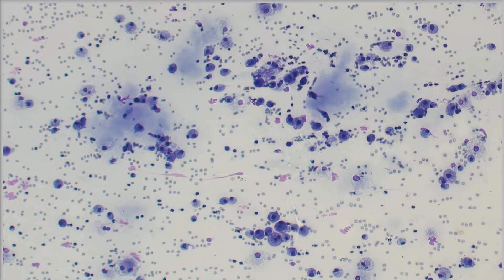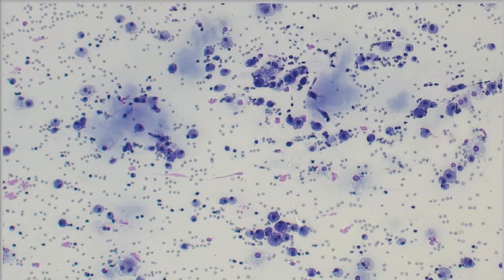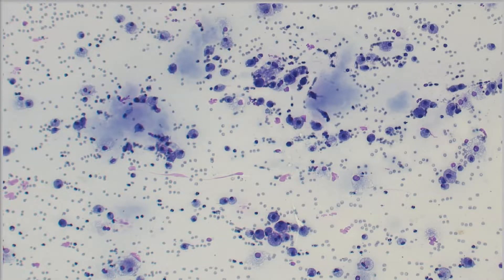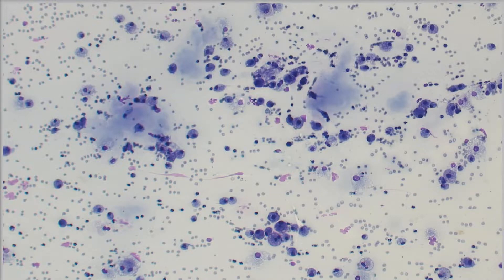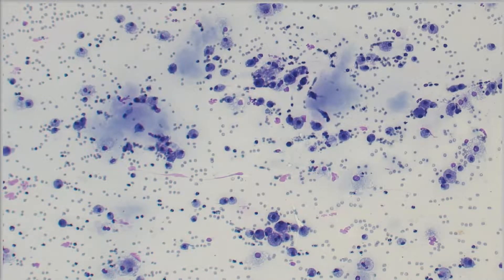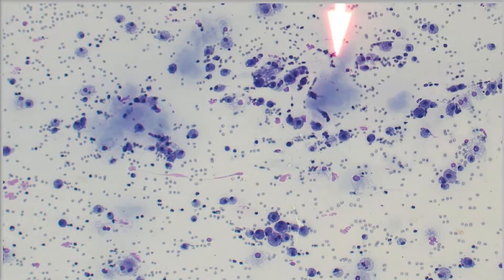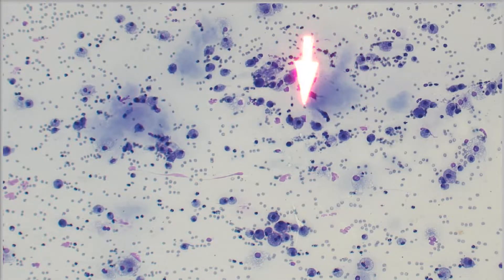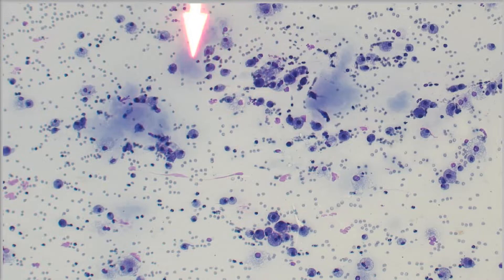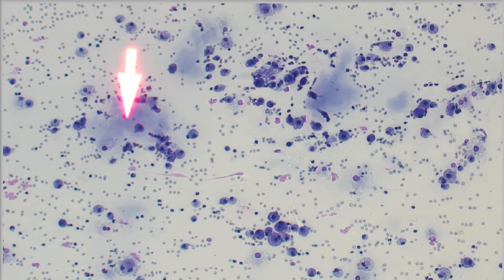So definitely inflammation. That's not specific for anything in particular, but we have to keep in mind where we are location-wise in this dog. This is a swelling underneath its tongue. And then we start to notice another clue — these pools of this basophilic, kind of amorphous material scattered throughout this sample.